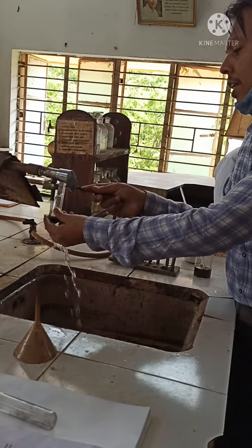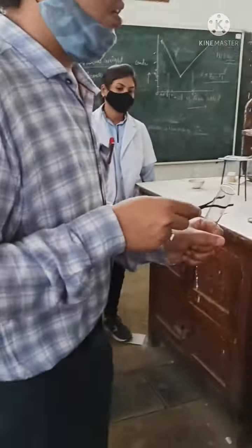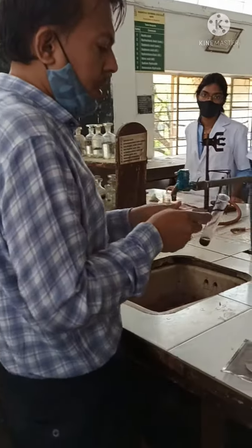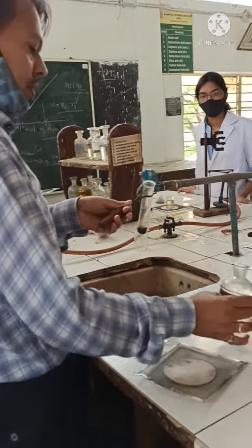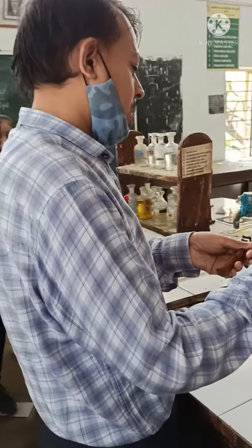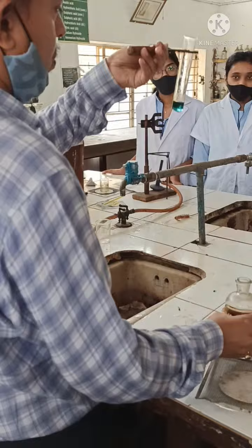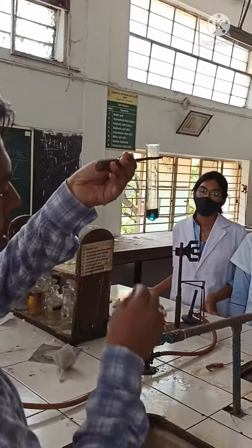After that — it is not fully cooled yet, okay? But besides that, add it. Just one drop. We will have to add one drop of H₂SO₄. And it comes with a Prussian blue color.